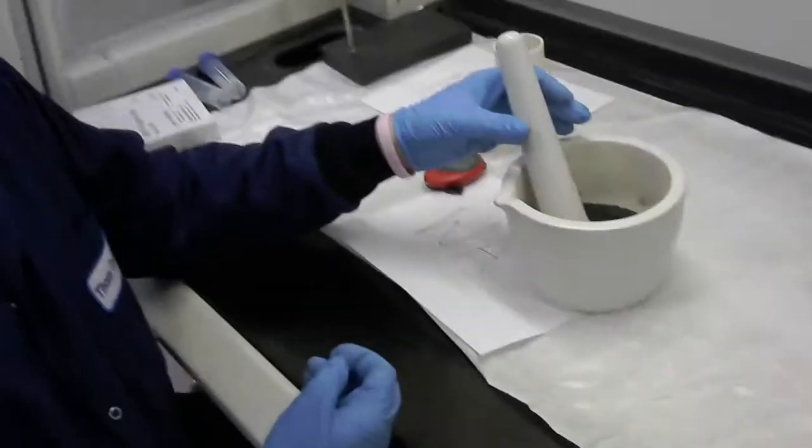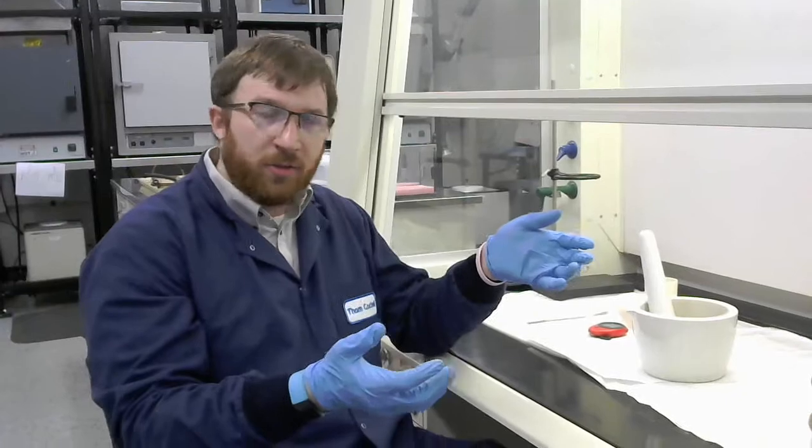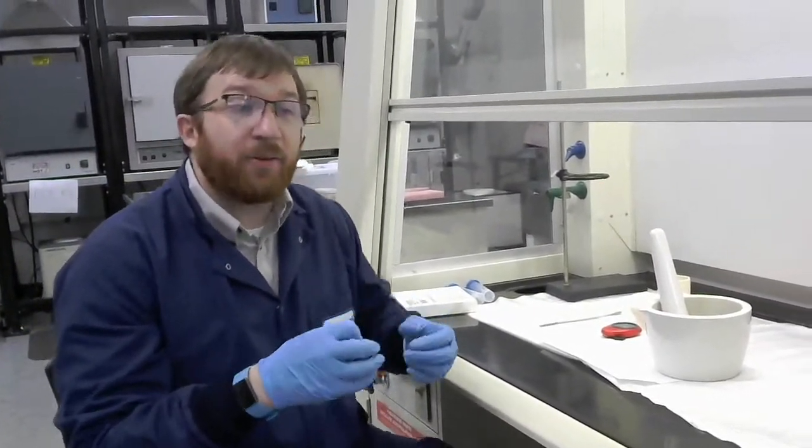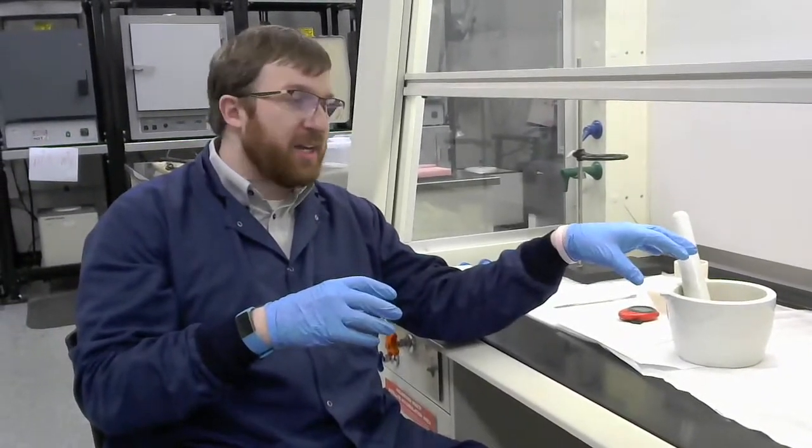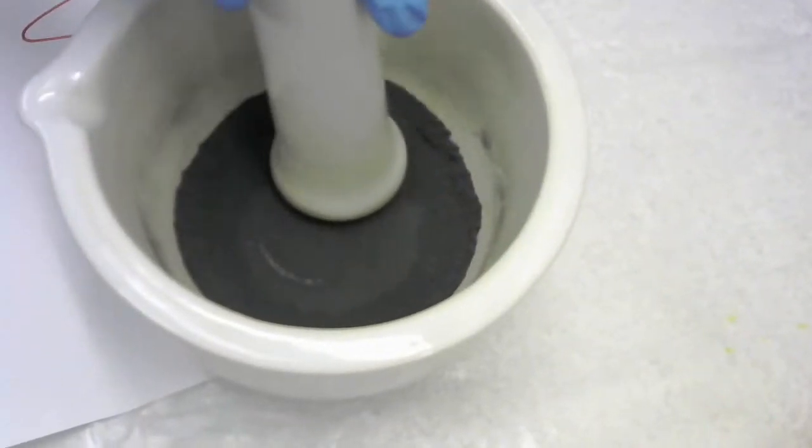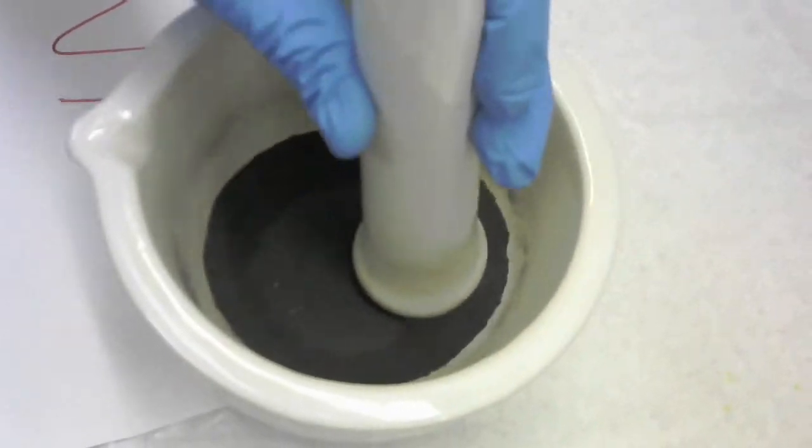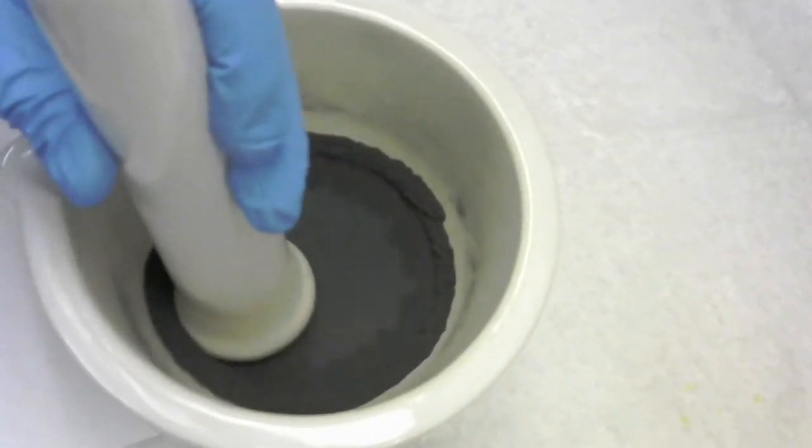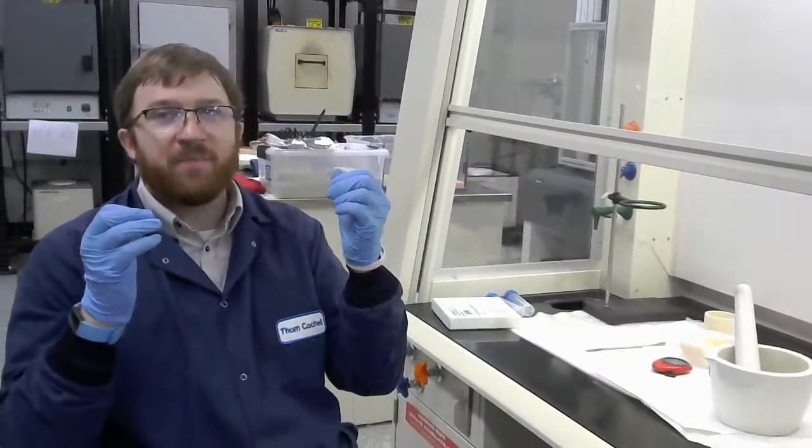Also something that's going to be very difficult for the camera to pick up and I'll just kind of explain. But if you have crystals in your mortar and pestle, so let's say you start with salt. If you start with table salt, you will see a lot of reflections from the single crystals, right? So it will look kind of sparkly in the mortar and pestle. So the same applies here for the YBCO. So when we started to get this down to a powder size, for the most part it looks like a dark gray, maybe black powder. But if you can, again you might not be able to see this in the camera so I'll just kind of explain, but every once in a while you'll see a little bit of a sparkle. And so that is a crystal. And if you can see it, it means it's fairly large. So typically when you see those sparkly bits that means that you're not quite done yet.